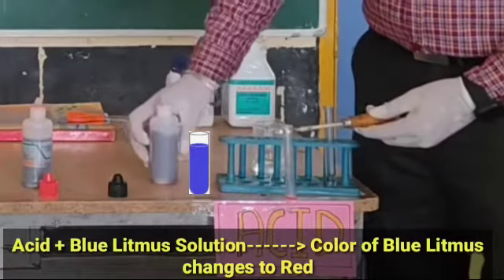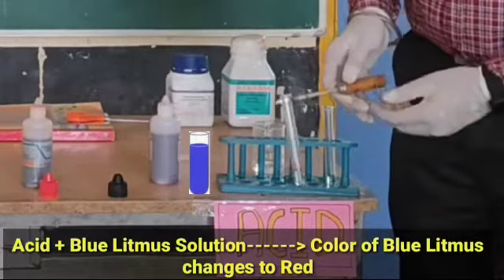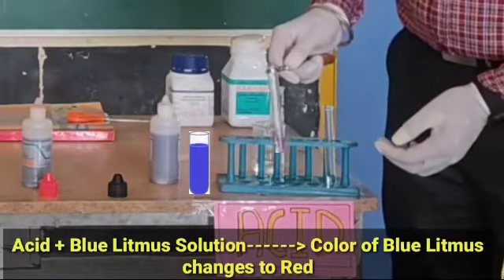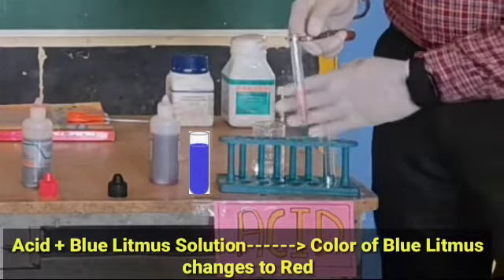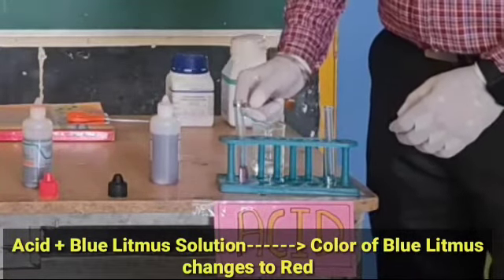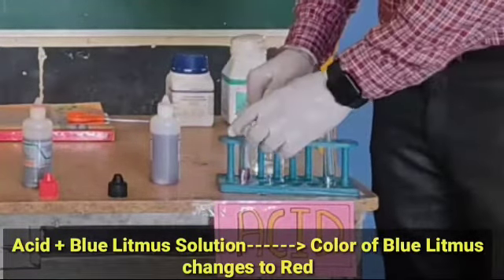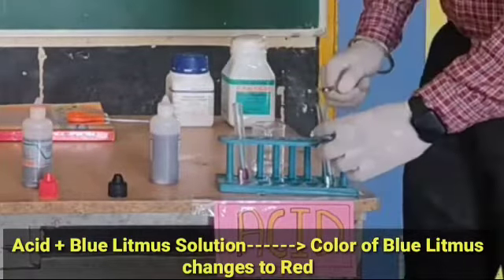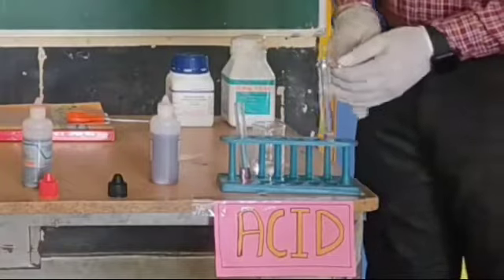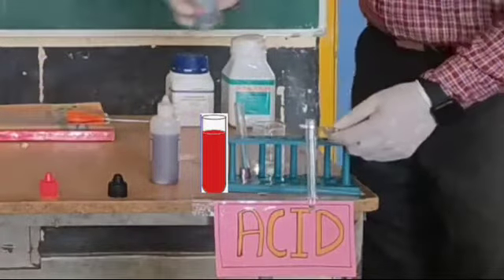As you see, as I pour the blue litmus in the acid, its color changes into the red. So now you can see its color changes into the red. So blue to the red, and let's see what happened to the test tube when we pour the red litmus.